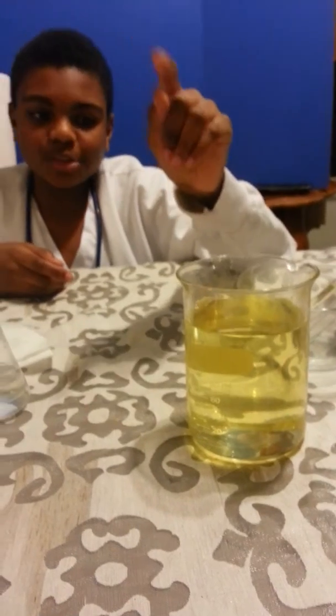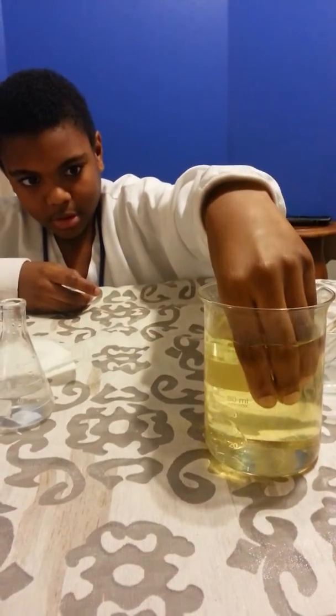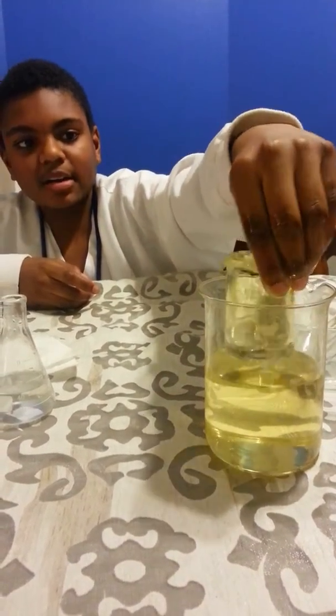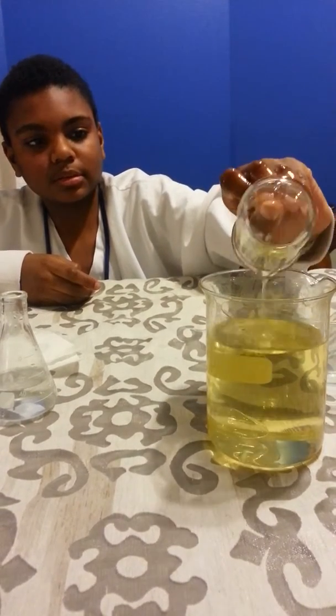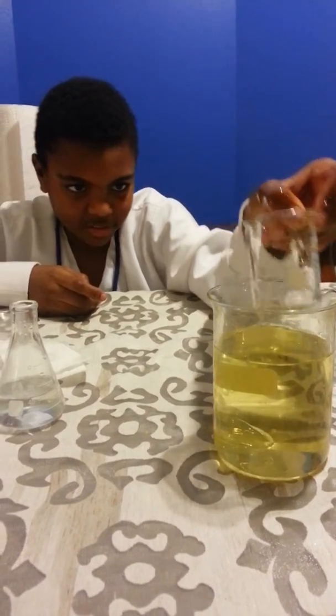Wait a minute, I have one more surprise for you. This whole time, I had another beaker in here. That's cool, isn't it?